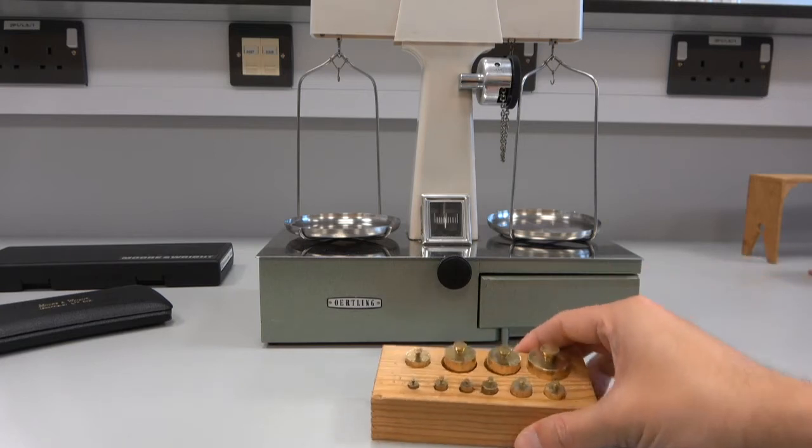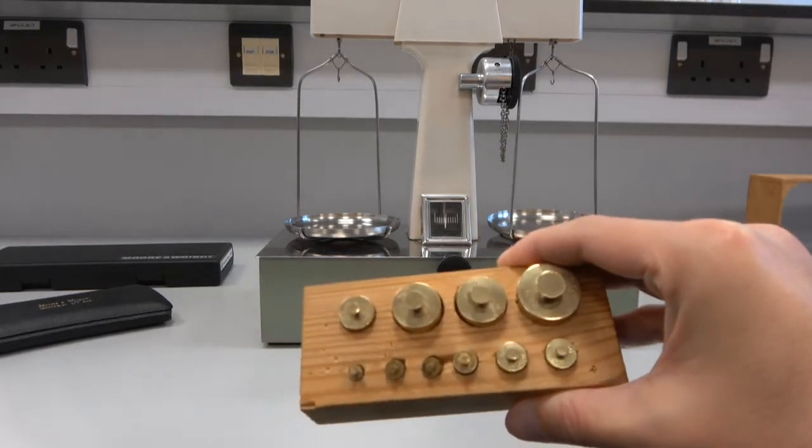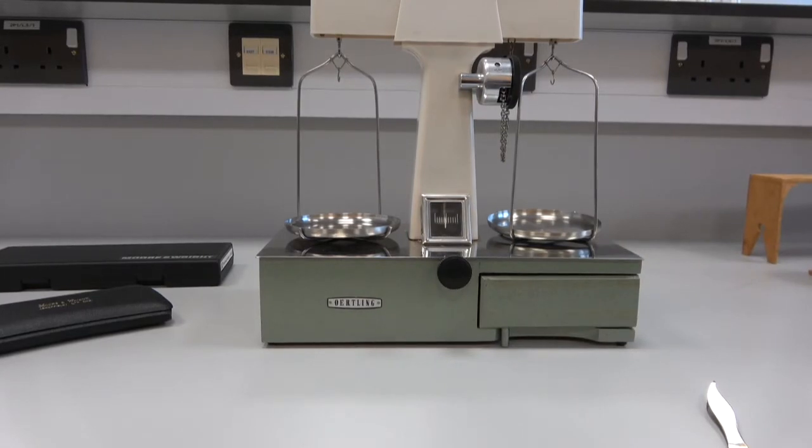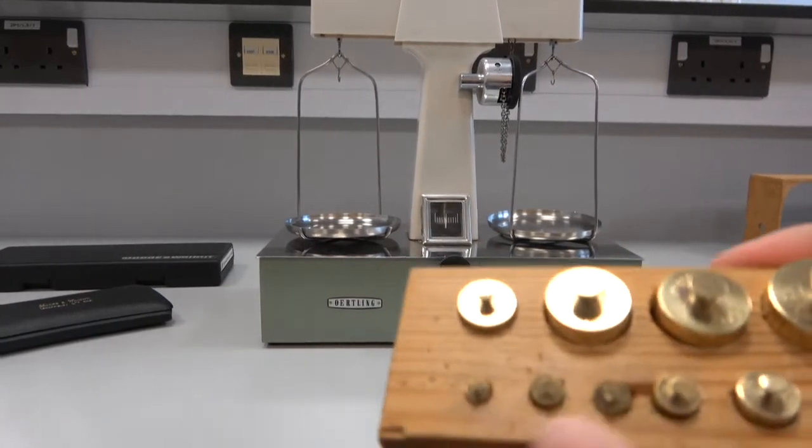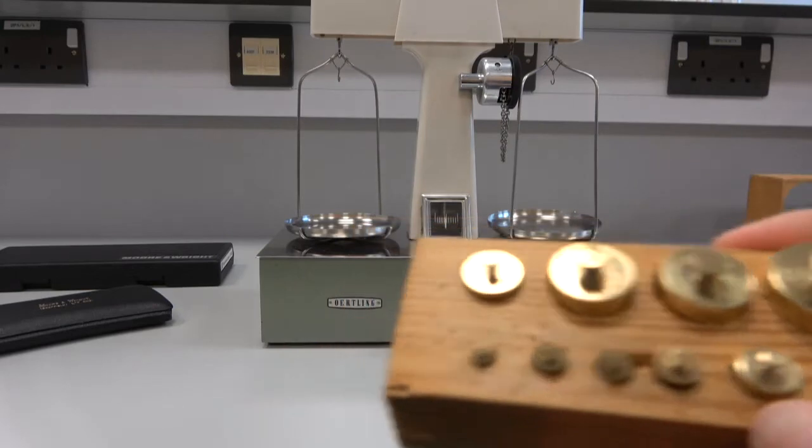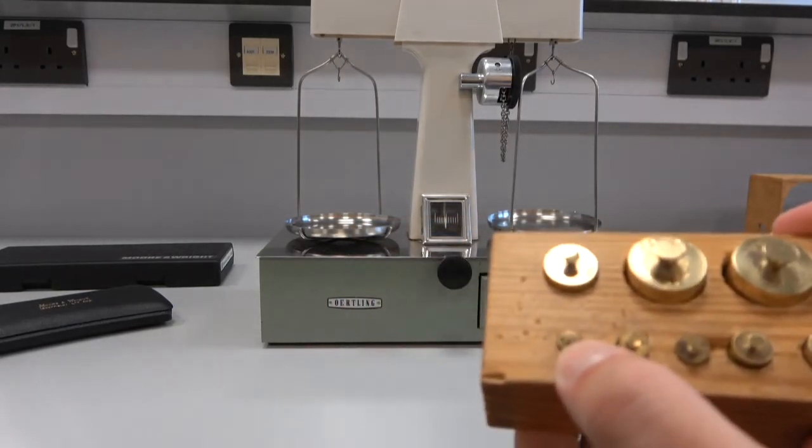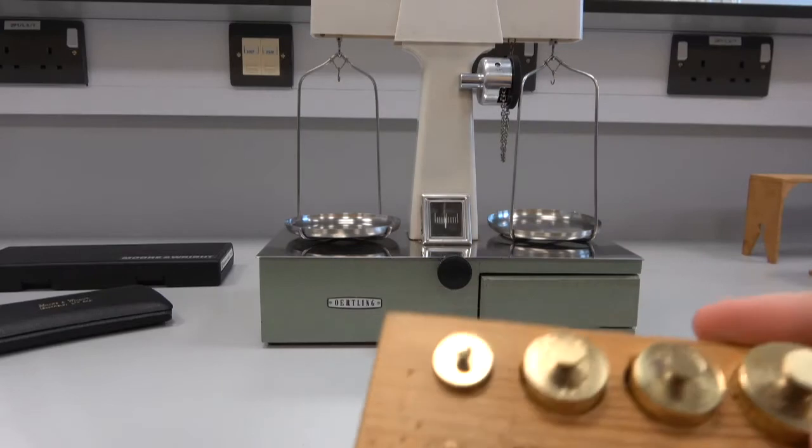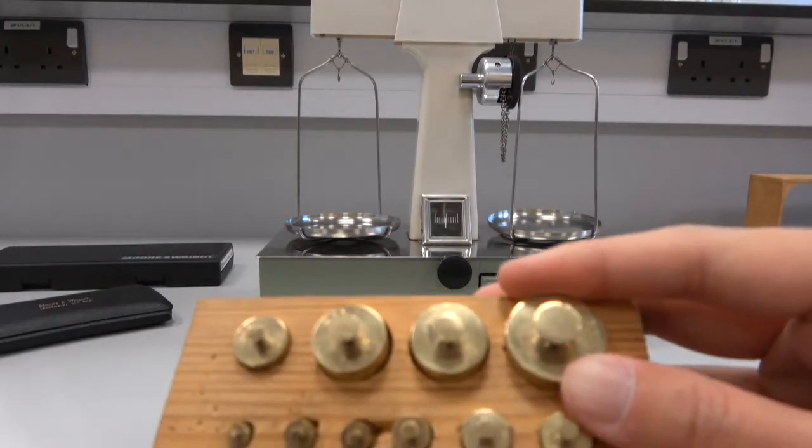If you have a look here, these are our standard masses. The numbers are a little tricky to read, probably. They're a little corroded, but you can see they range from about 1 gram, which is this one, all the way up to 100 grams, which is this one.